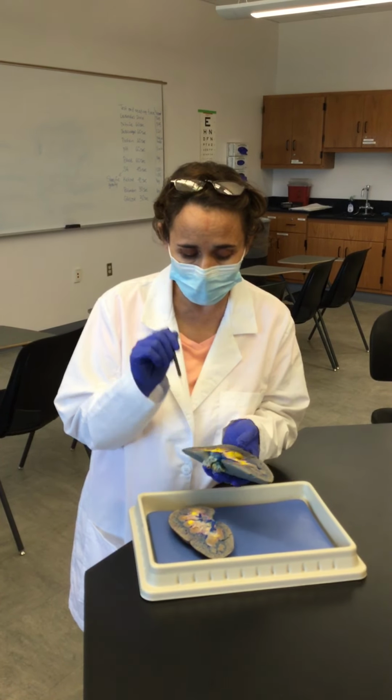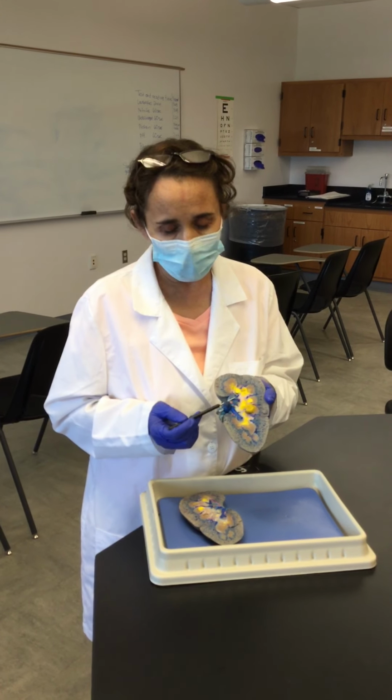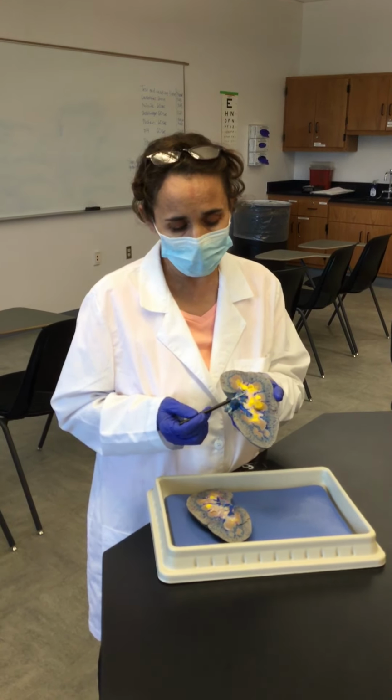Now for the blood supply of the kidneys, it comes from the aorta. So the aorta sends these lateral branches that are called the renal arteries, and then the renal artery enters into the hilum, and once it enters into the hilum, it makes 2 to 3 segmental arteries. And then these 2 to 3 segmentals go deep, penetrate, enter into the columns, and now inside the columns are going to be called the interlobar arteries. And then the interlobar arteries will follow the apex of the pyramids. They make like a little turn, not a complete U-turn, but a little turn towards the base of the pyramid, and then they will be called arcuate.